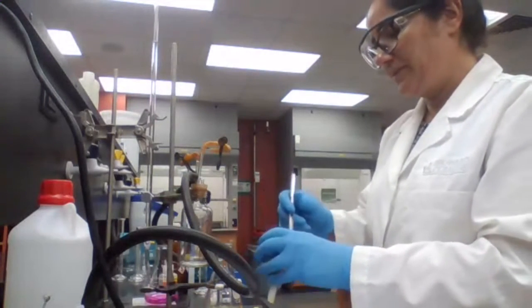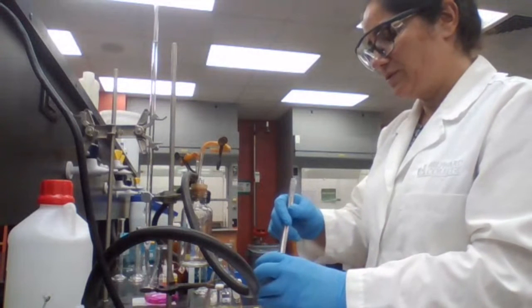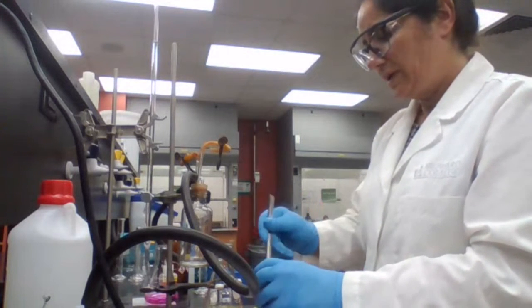Melting point for this sample is going to help you to determine what your unknown is.